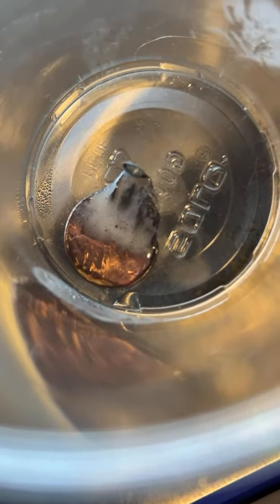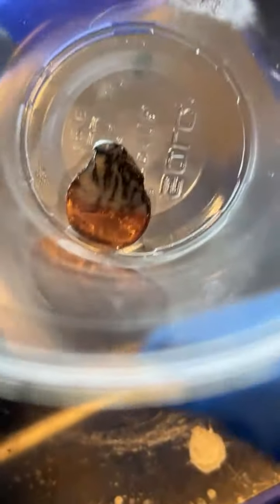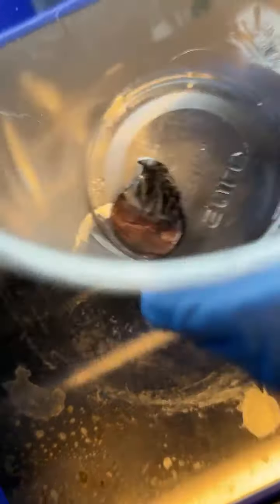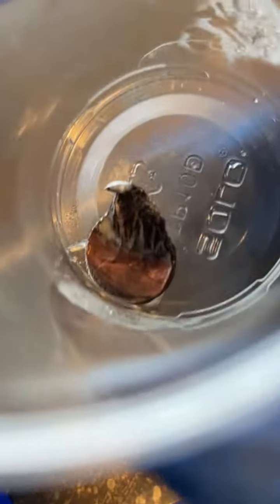So again, you can see that the bubbles are forming on the zinc side. Look at the steam coming off. You see that a little bit? Oh gosh, a little bit of fumes. Woo! That doesn't smell real good. I wonder if that's because it's reacting with the cup. Come on, man, y'all are making me kill myself down here. Oh, gosh, that smells awful. Anyway, you can see that the zinc is reacting and foaming, but the copper is not.